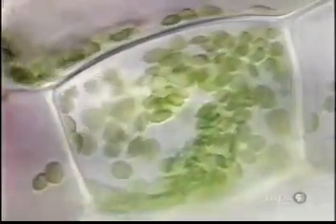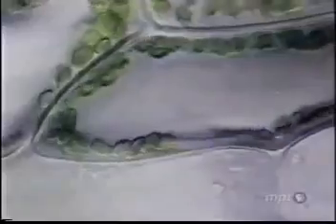Elodea leaves are made up of just 2 cell layers, offering an unobstructed view of living chloroplasts. The orientation of the flowing cytoplasm determines the amount of light hitting each chloroplast. When light levels are low, the flow is adjusted so that the chloroplasts get full exposure. Under the more intense light of midday, they circulate around the sides of the cell, reducing exposure to harmful ultraviolet radiation while still receiving plenty of light for photosynthesis.